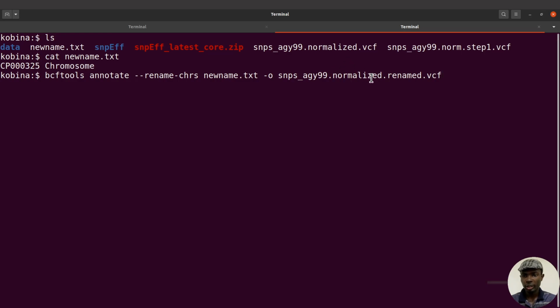Remember, we have normalize, and I've added this information, renamed. So this tells us that it's normalized, but we have renamed something in it. I always try to add some information to my file so that anyone looking at it will have an idea of what the file is. Okay, now let's specify the input file, and that's going to be this one here. So I'll just do a copy and paste. I can just type snips normalize.vcf like this. Okay, so this becomes the final file.